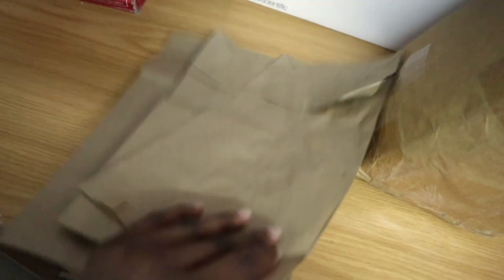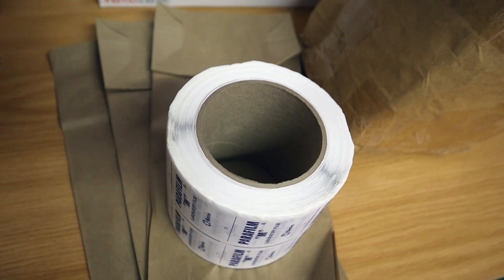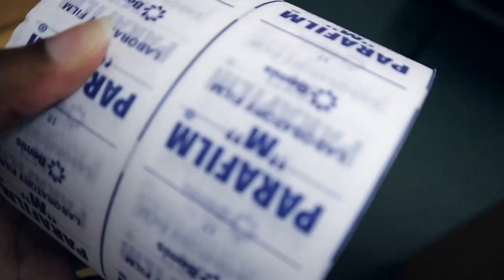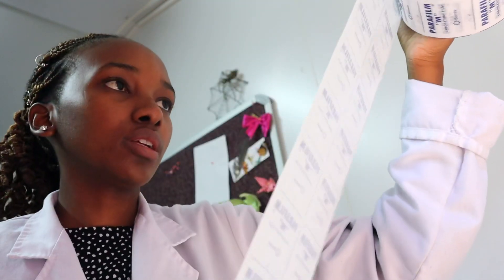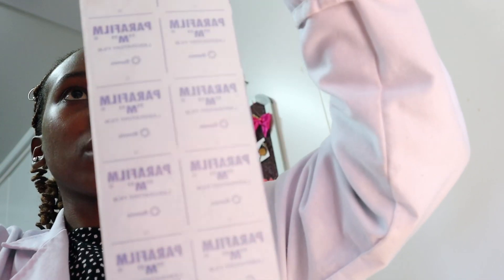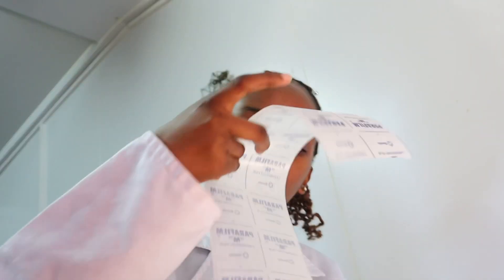This is the brown paper I'm talking about. I'm going to use this to collect my samples at the greenhouse. And I also need parafilm — this is parafilm. We use this to seal up our petri dishes. I only have 20 plates so I only need about this much. So this is all I need.